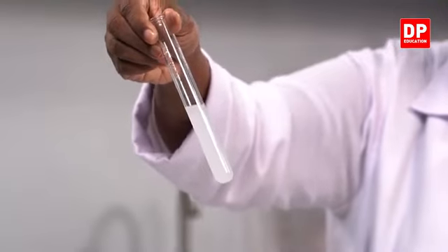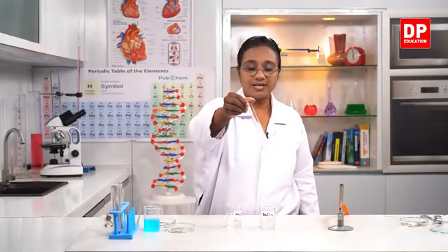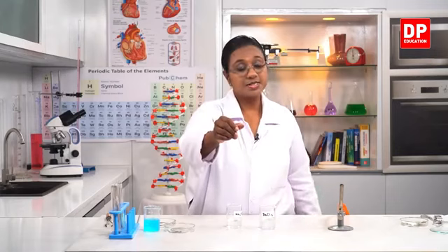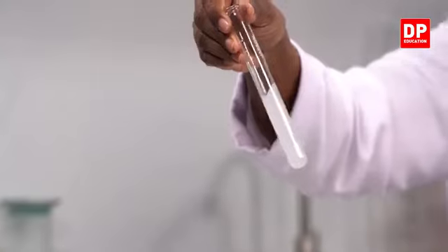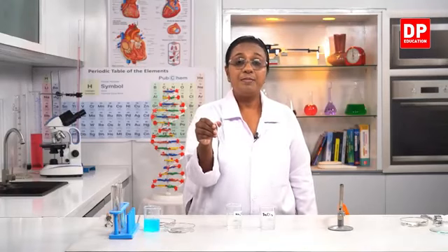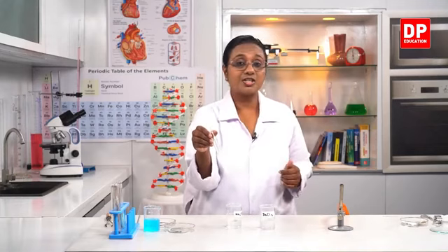And if we allow it to stand for some time, we will see a white color substance depositing at the bottom of the test tube. So here we used two reactants, barium chloride and sodium sulfate. Now there is a chemical change taking place. That is why you get the whitish color or milky color solution. And in that, there is the formation of barium sulfate and sodium chloride. So as I told you before, there are different ways in which the reaction takes place.